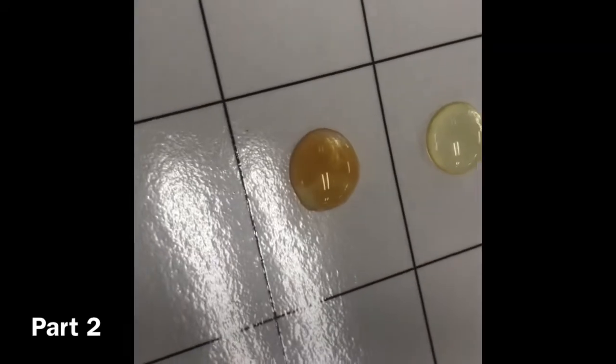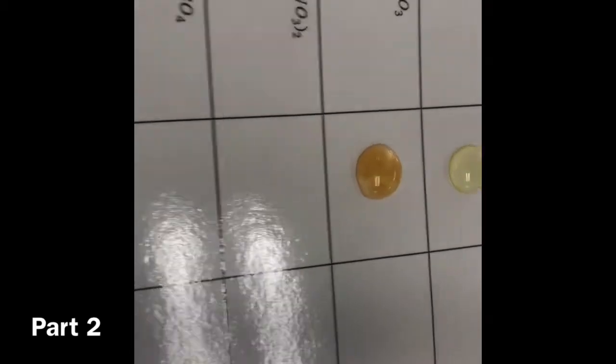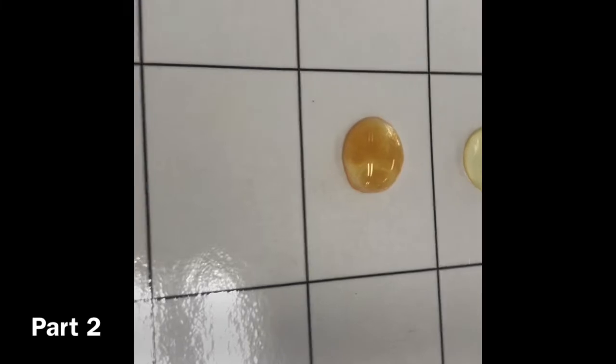CO2. Dude, there's no. Here, wait. I don't have my phone. I'm gonna get a flashlight. Well, trust me, guys, when I say that changed color. Oh, flip, bro. What color is that? I'm colorblind. Urine. Orange. Okay. Moving on.